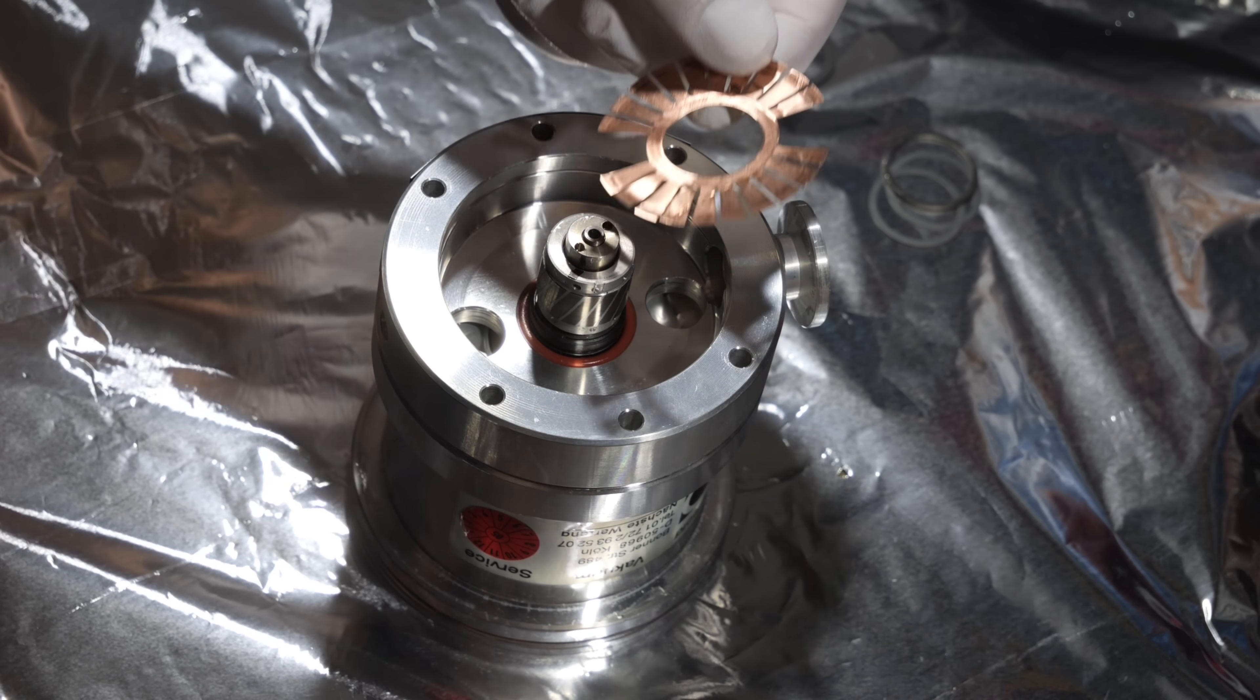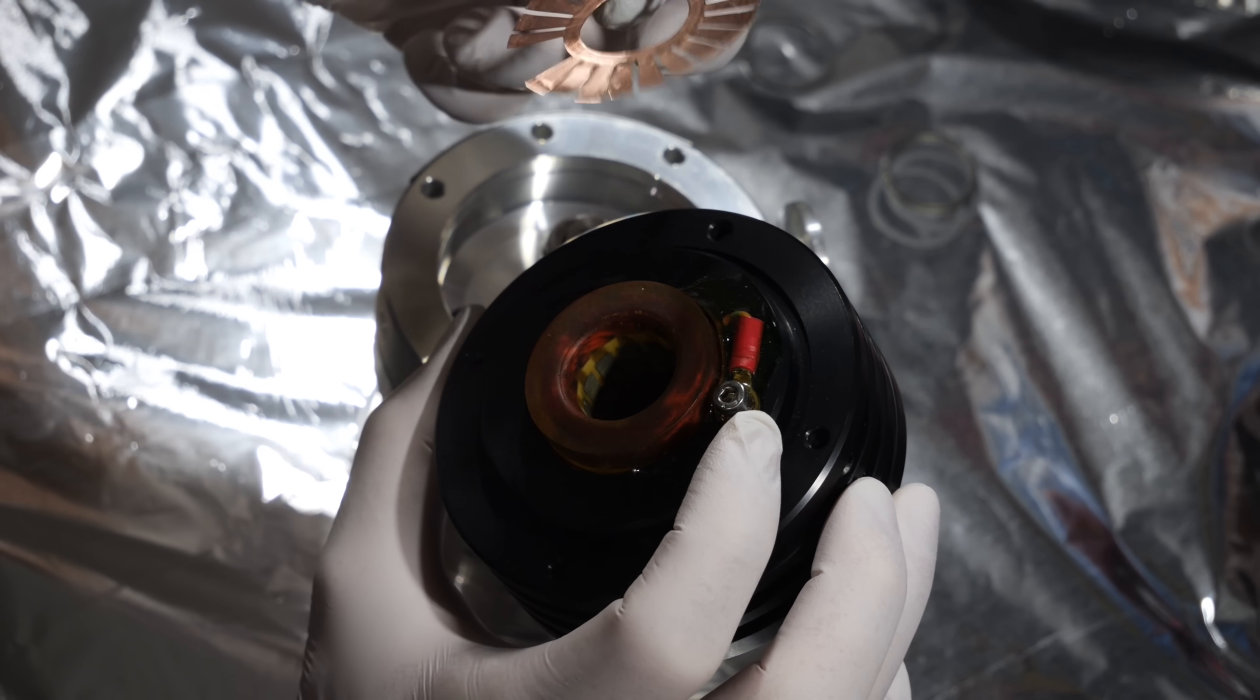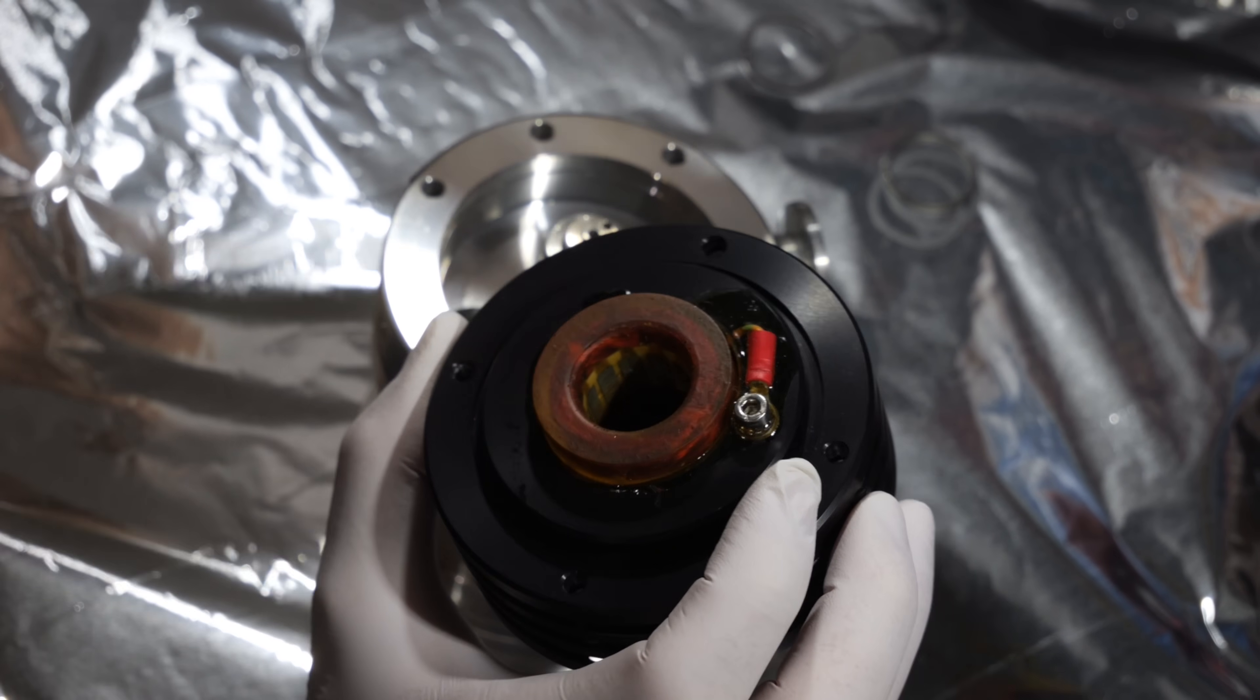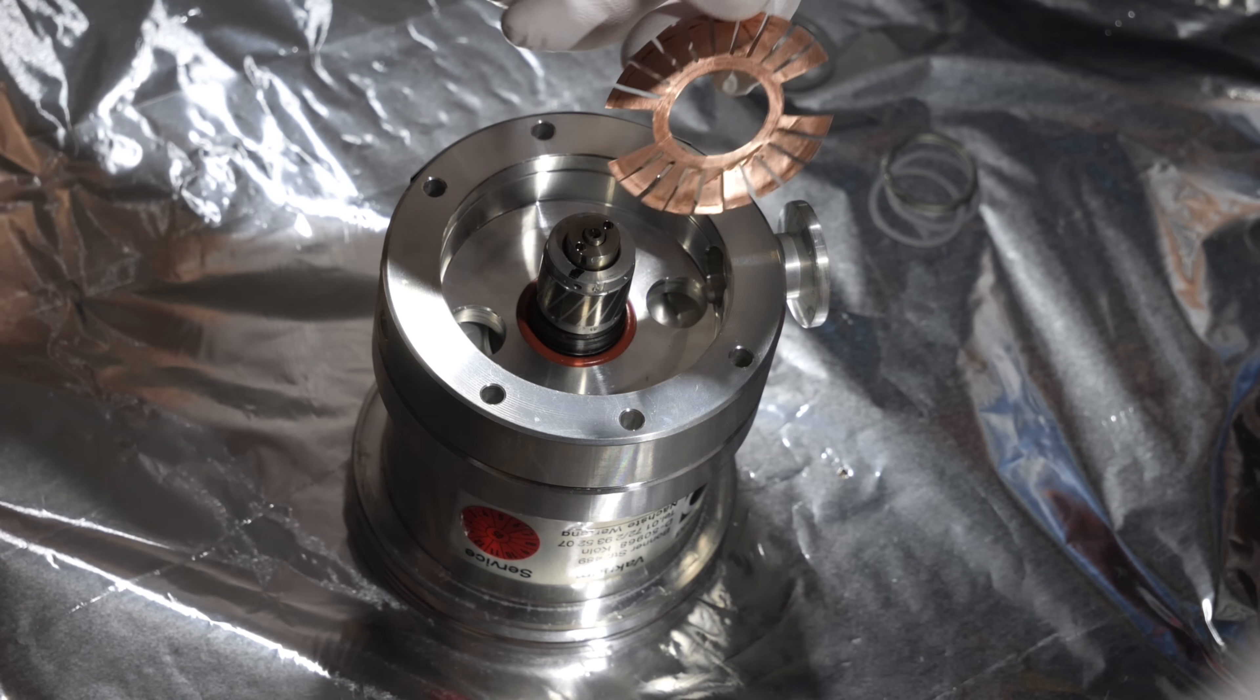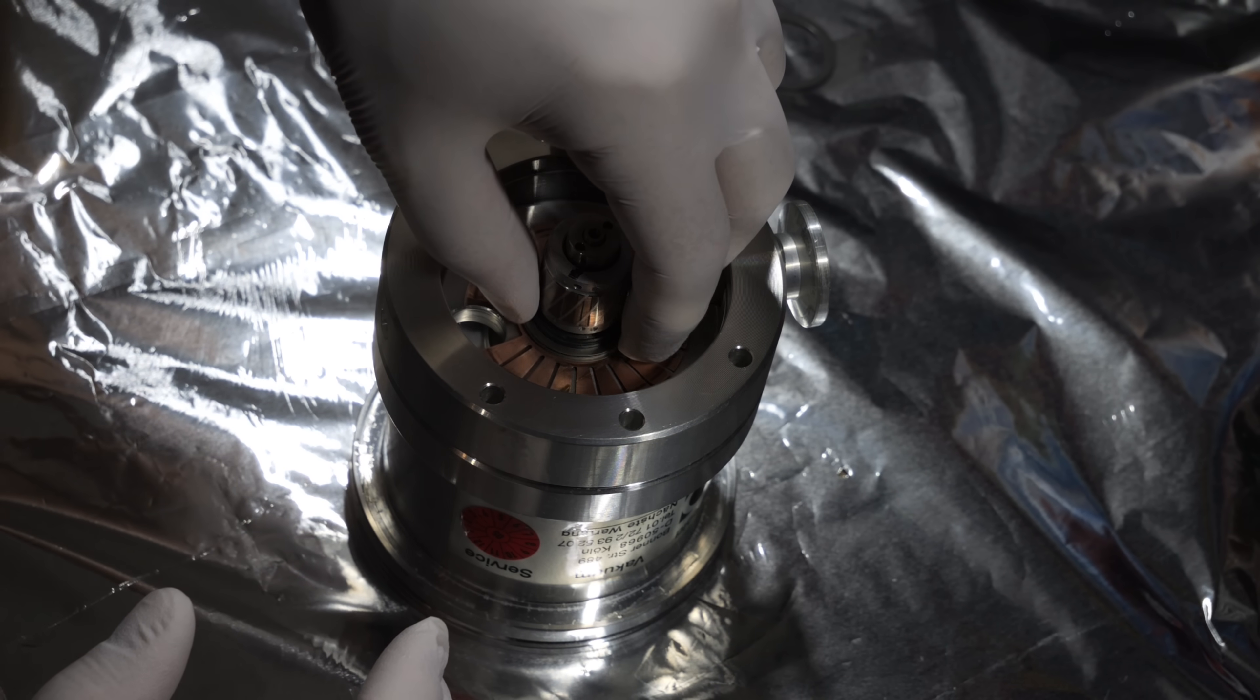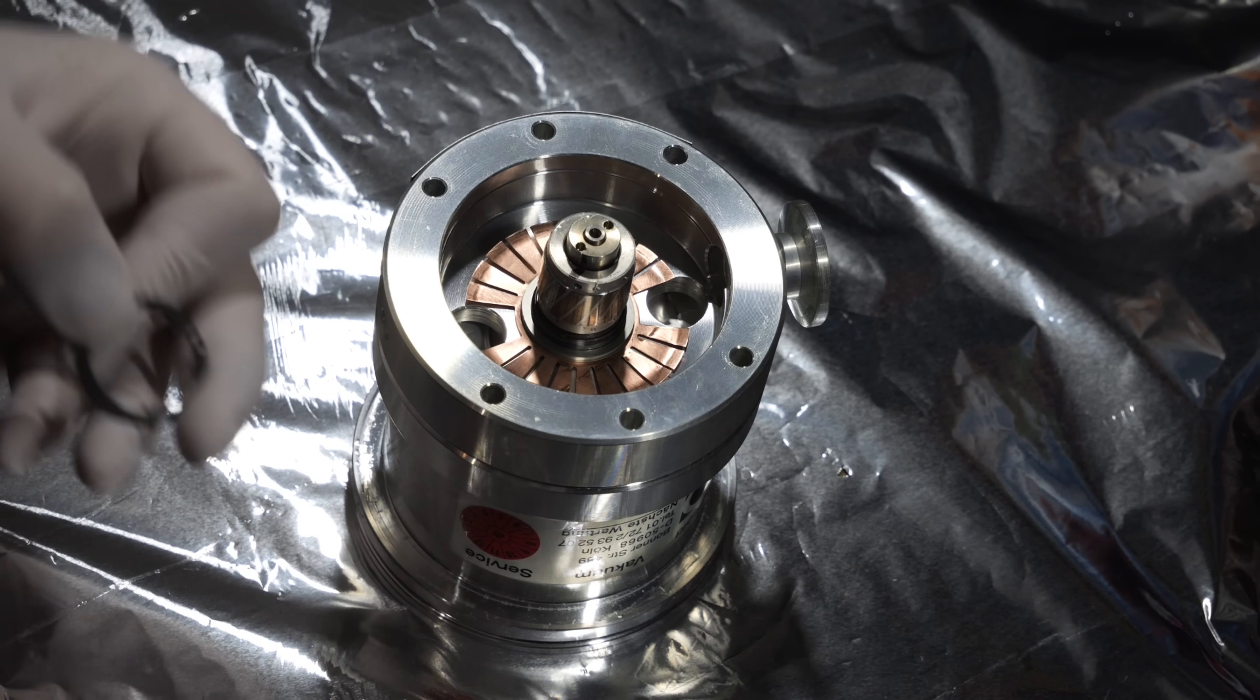It's not spinning with the rotor. And there is no pickup here which might get some signal from this copper piece. So I have no idea what it is for but we will put it back. Then there are these spacers. And lastly comes the circlip here to secure the rotor.